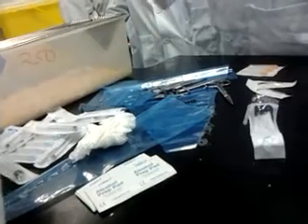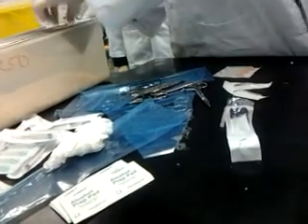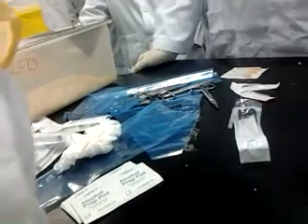When you do anesthesia, we normally don't use bedding, because they inhale a lot of wood shavings. We place it somewhere ventilated, on top of the cage there, so you can see they breathe well.